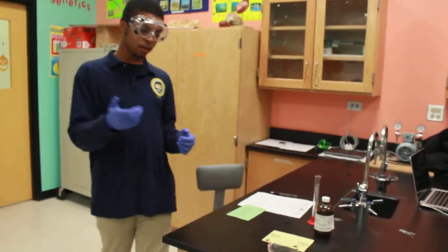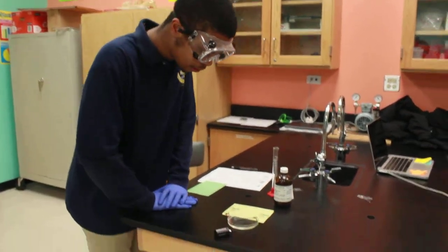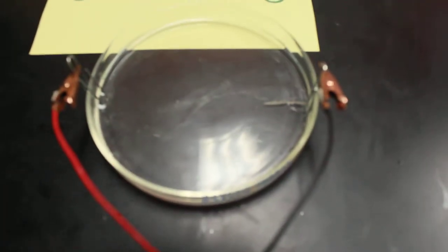And in a little bit, it will be growing, as you can see right now, it's growing pretty rapidly to the point where you can see it with the naked eye.